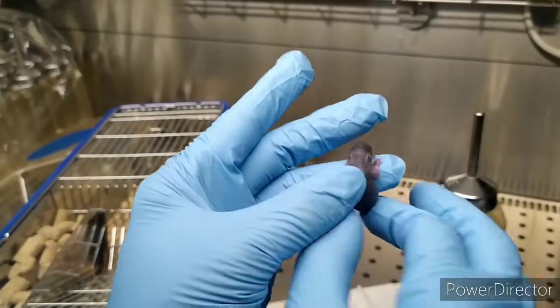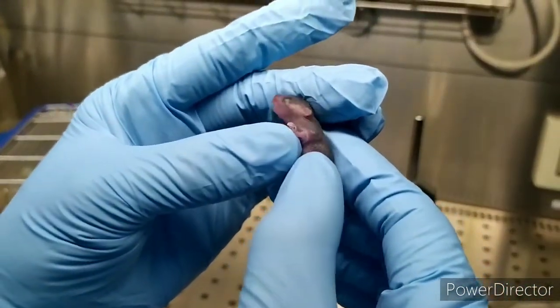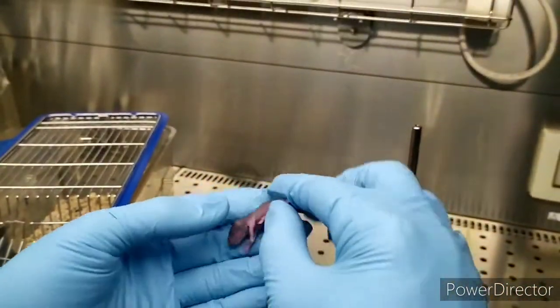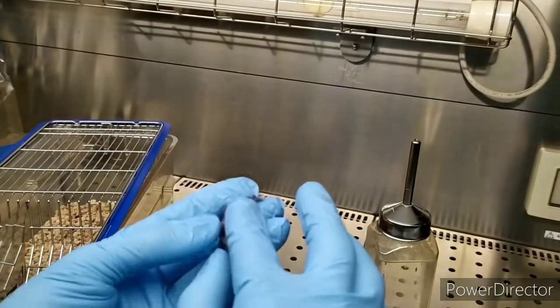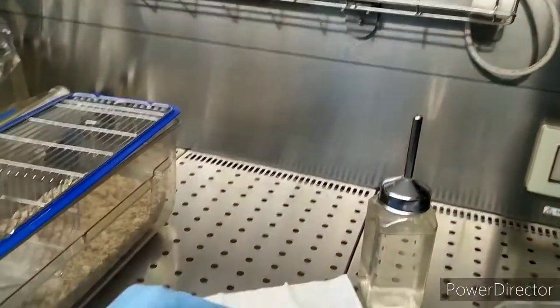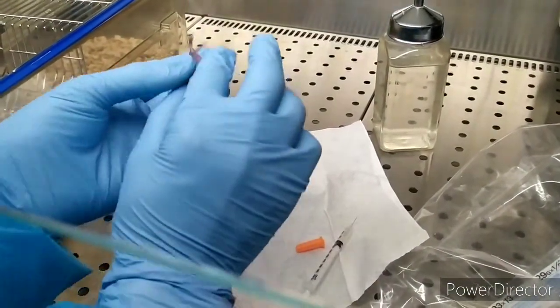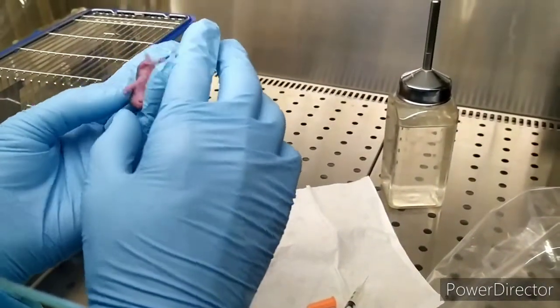This is number one. How do you understand number one? The finger — number one finger here. Someone called it. Yes, the label is number one. So you ring. Okay, slowly, slowly.